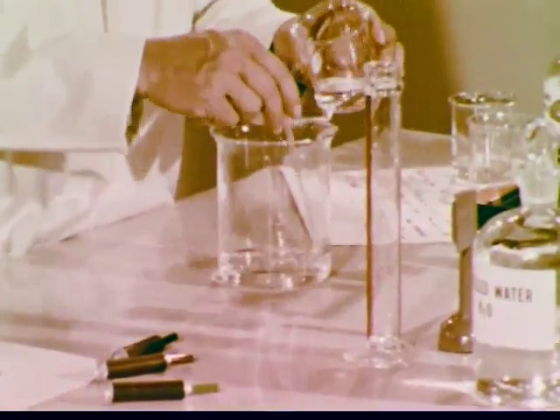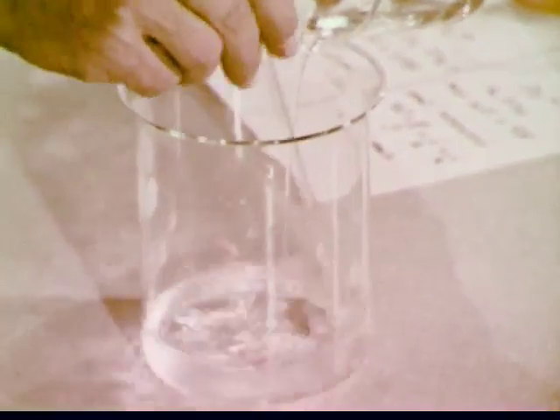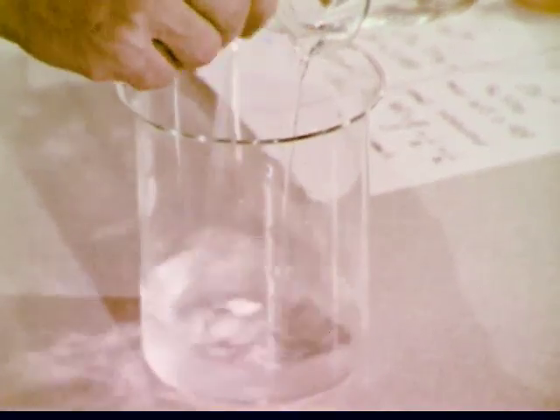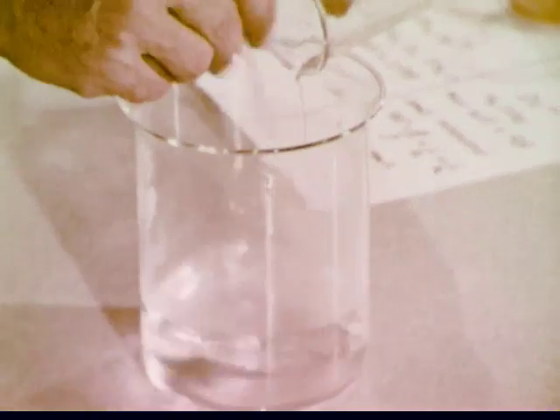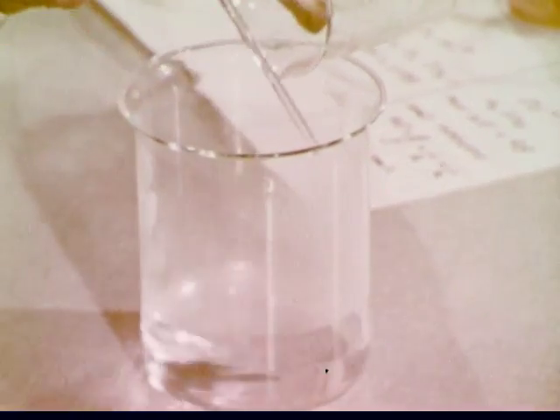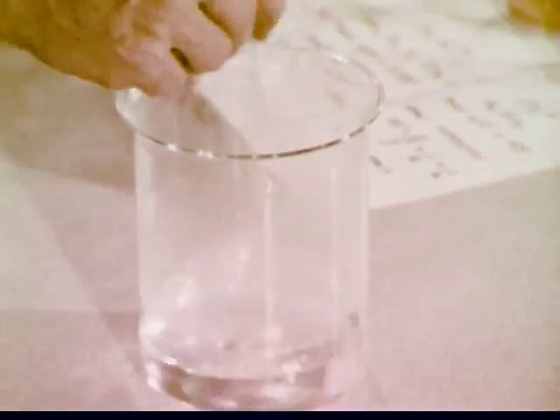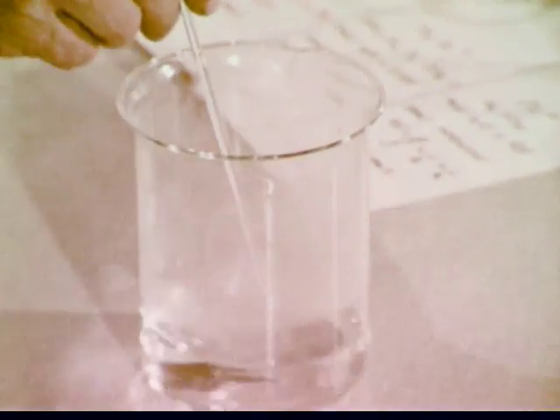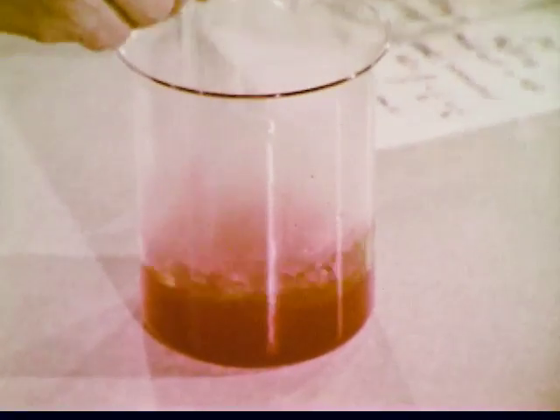Now the sulfuric acid is diluted with water. This must be done carefully by pouring the acid into the water while stirring constantly. Note that the heat of reaction vaporizes water, which condenses on the side of the beaker. To the sulfuric acid and water, the sodium dichromate is added, giving an aqueous solution of the oxidizing agent in the form in which it is used in the reaction.